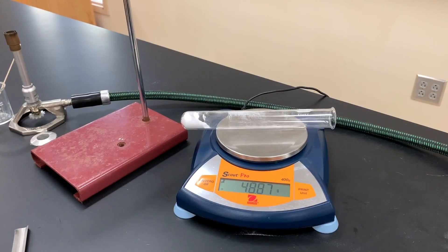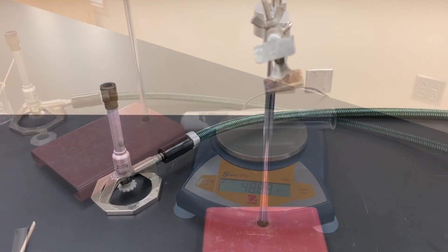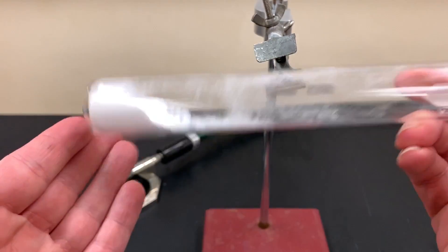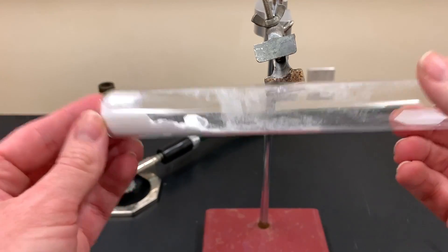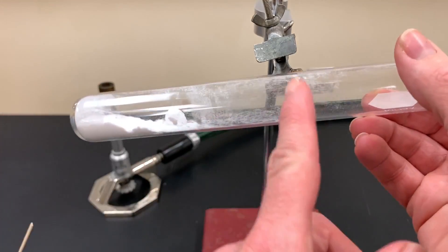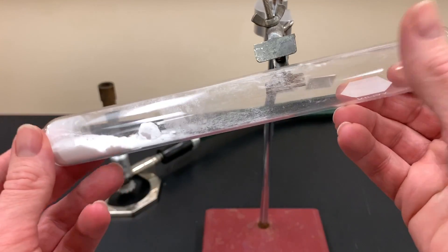So again I said 48.87, record that. On to the next step. The next step is to get your baking soda at kind of an angle in the test tube like that so that you can get a nice even heating of that solid. I do have some up here that I'm going to have to worry about heating.